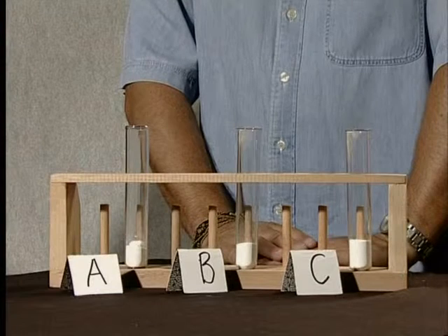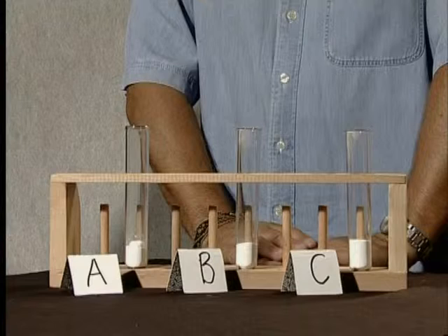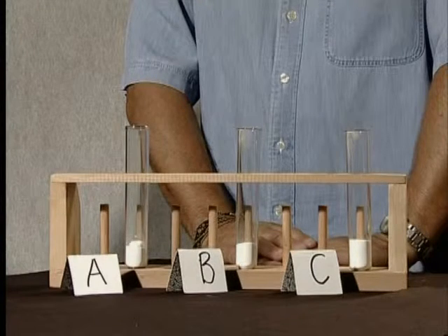We have placed them in 3 test tubes labelled A, B and C respectively. Notice that all 3 of the salts are white. We have also been given a range of substances and other tools to assist us in our investigation to determine the cations and anions of these salts.